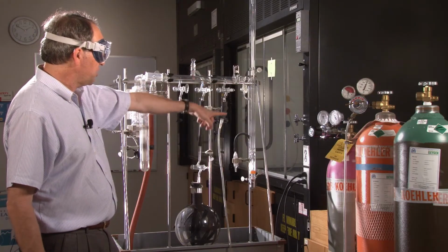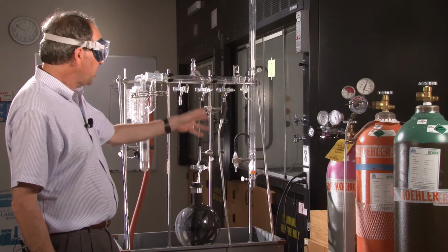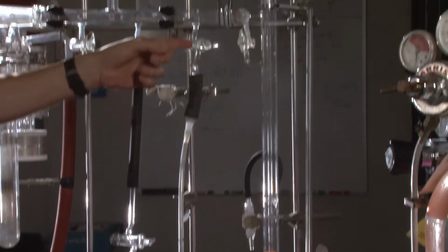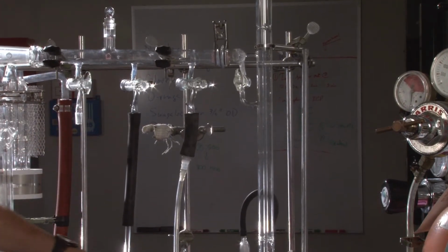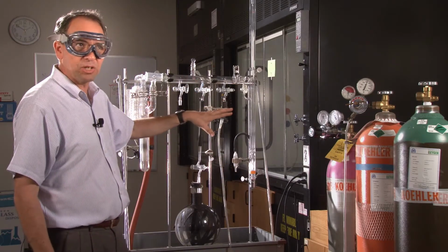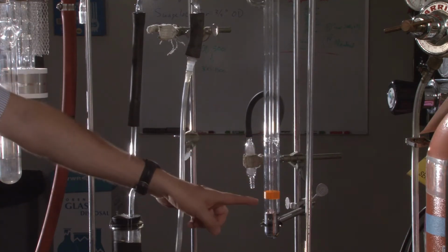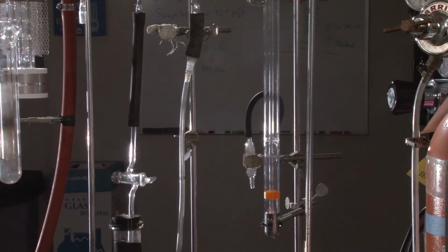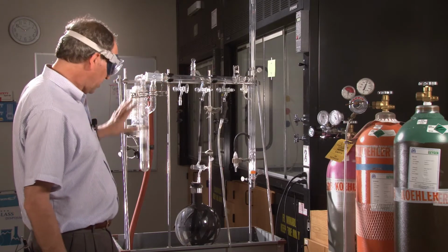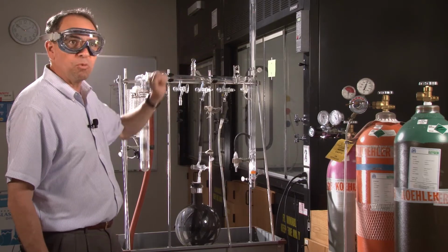This device is a mercury manometer. This is used to measure the difference in pressure between the room and the manifold itself. When the pressure inside the tube is the same as the pressure outside, then the level of mercury in this inner tube will be the same as the level of mercury in the little pool there. As this tube and the apparatus is evacuated, the level of mercury in the inner tube will rise.